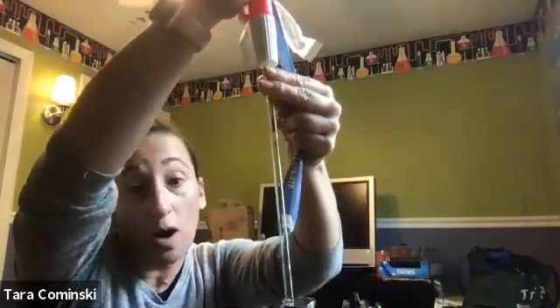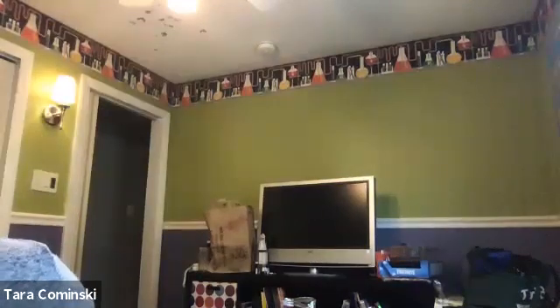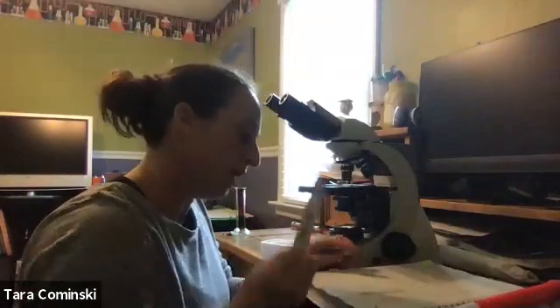You can also use a smaller graduated cylinder, like I said. Okay, so again, important to choose the appropriate piece of equipment or appropriate glassware to measure the appropriate volume. All right, so that's sort of a side note, I guess. All right, so we're still following along what we were doing before. We're on number 2 on page 12.